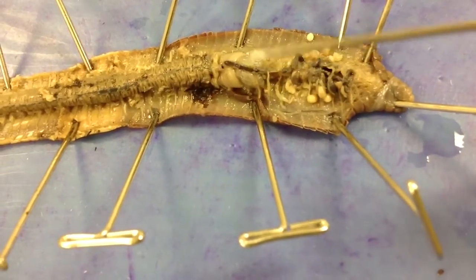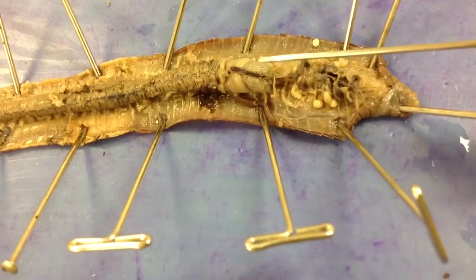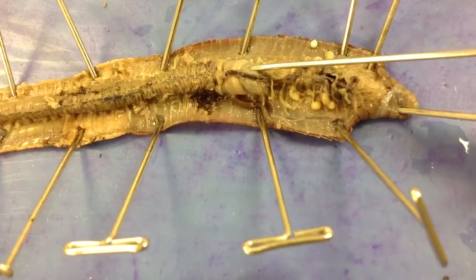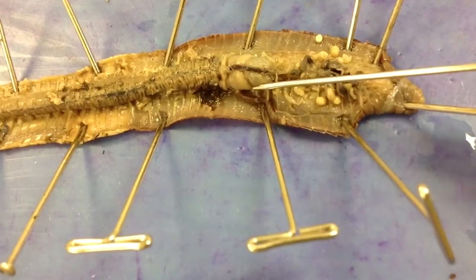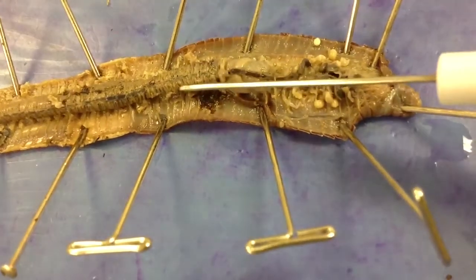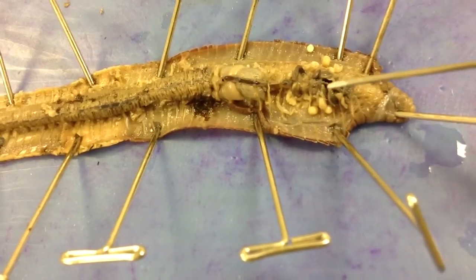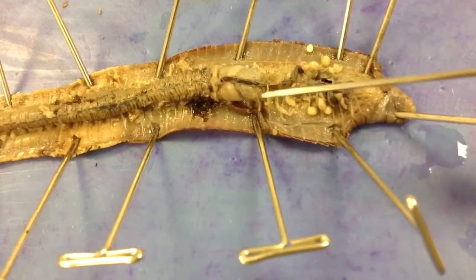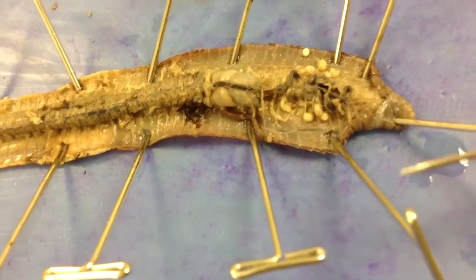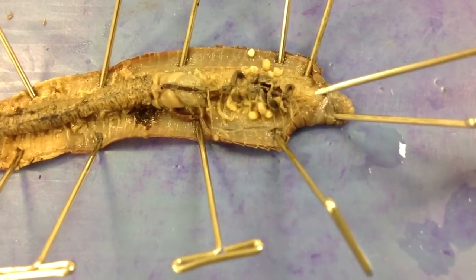Those are the two main things to visualize in this dissection: the differences in the digestive system, where we start to see specialization with different organs having different jobs — the esophagus, the crop, the gizzard, the intestine — and a closed circulatory system with our aortic arches, the dorsal blood vessel, and the ventral blood vessel. You can also try to visualize different parts of the nervous system up here, though that's a little bit harder.